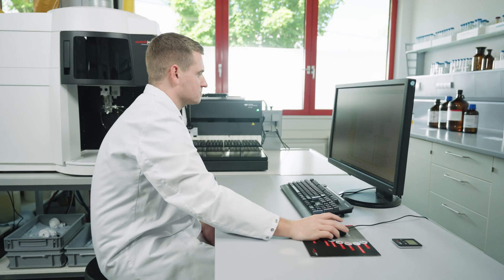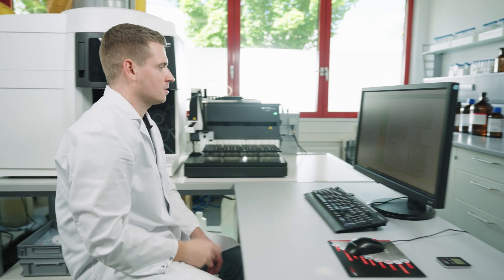Hello, my name is Sebastian. My colleague Sandro and I will show you some insights on how you can make your oil analysis with ICP-OES more efficient. Sandro will guide you through the entire workflow from sample preparation to data evaluation of oil measurements.